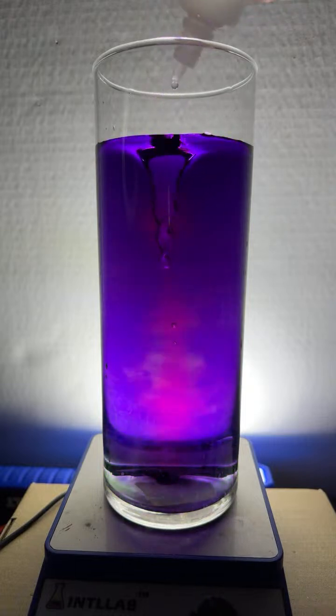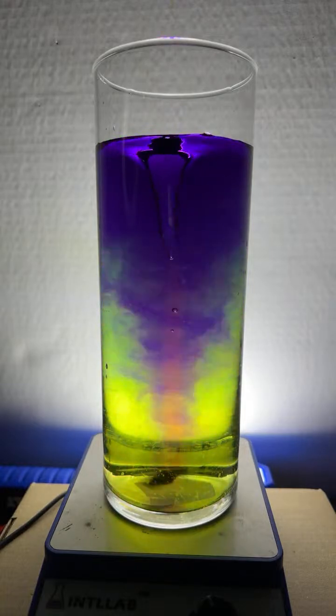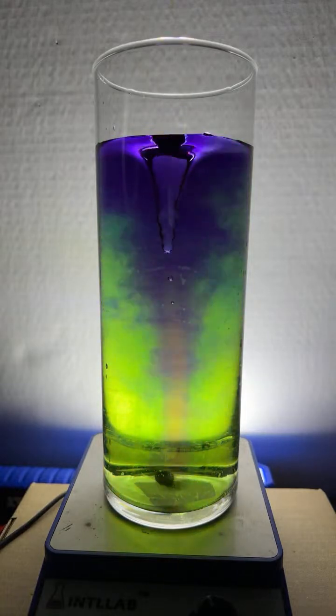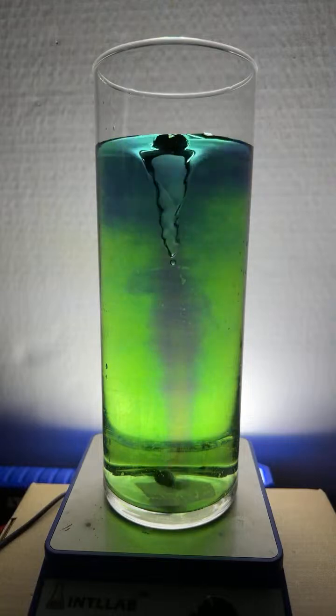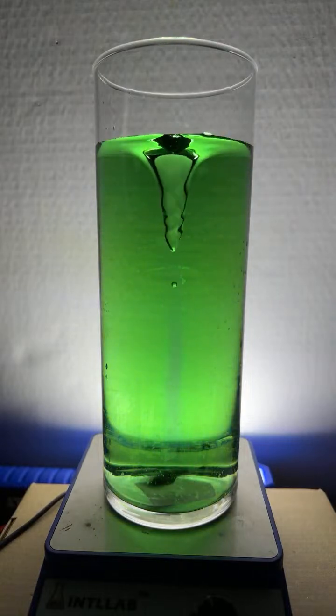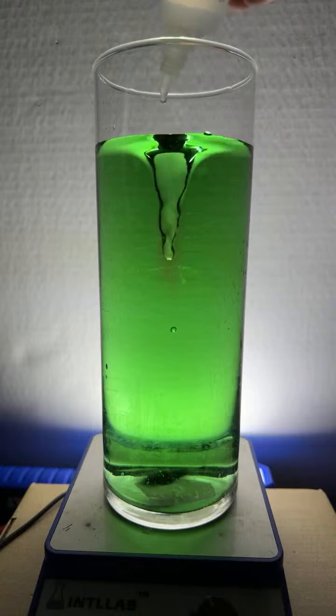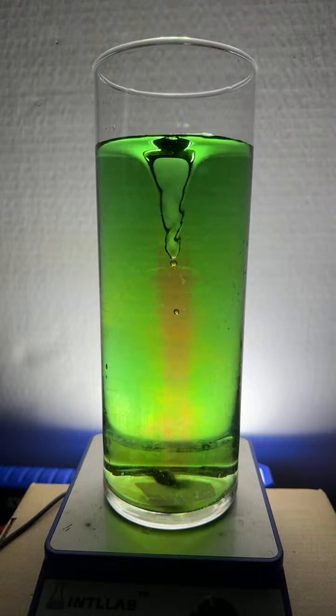Yeah, but I think we'd only see blue or colorless with that. And I don't want to mess around with a whole bunch of UV light. That's funny, Lilaba. So right now we're seeing green. That's pH neutral. Neither acidic nor basic. If I add a little squirt of acid here, it's going to go red.